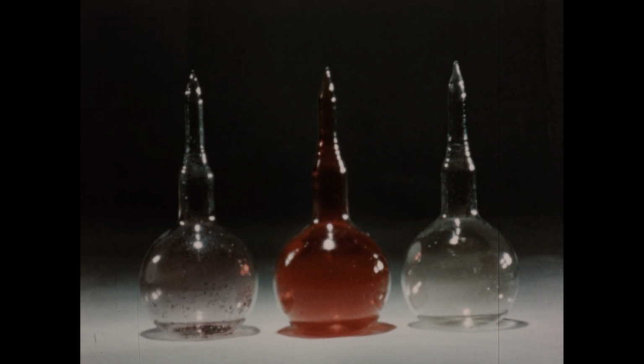In this film, we're going to be concerned with the methods of preparation of the free elements from their naturally occurring salts. We're going to be concerned with the reactions which the free elements undergo, and in the group relationships which these 3 elements exhibit. The 4th halogen, fluorine, is so active that its manipulation in the laboratory is difficult, and it will not be considered in this film.